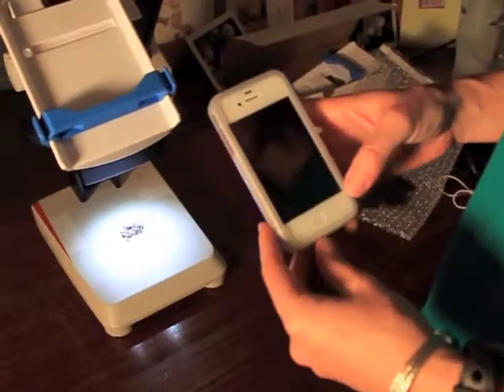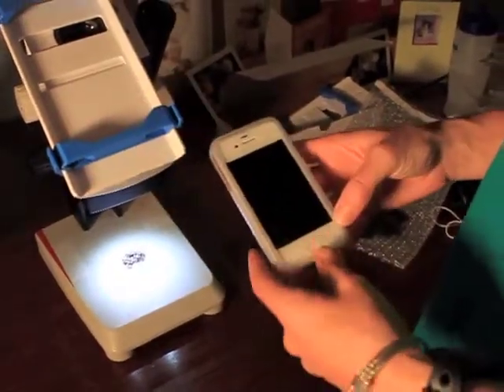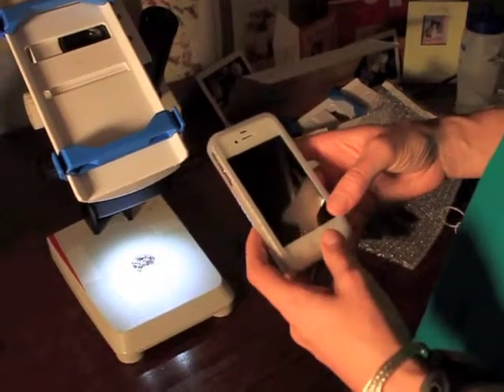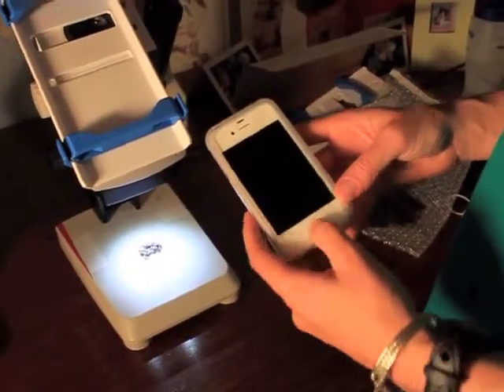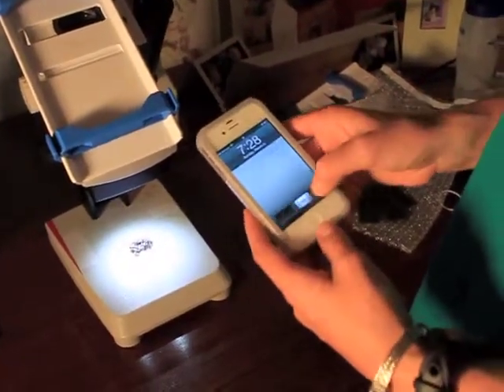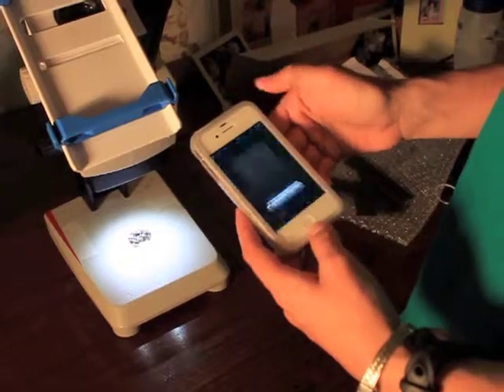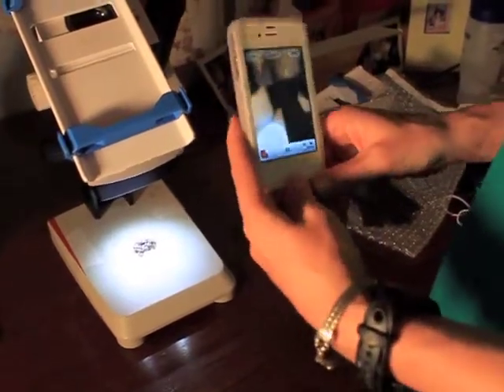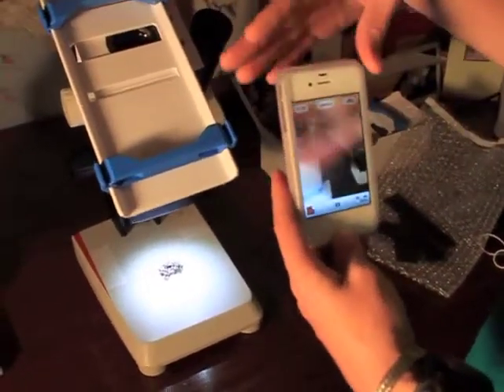Okay, so now that the skylight is on the microscope, the next step is to add the cell phone. Turn your phone on, turn on the camera — normal camera screen, just like the camera looks.